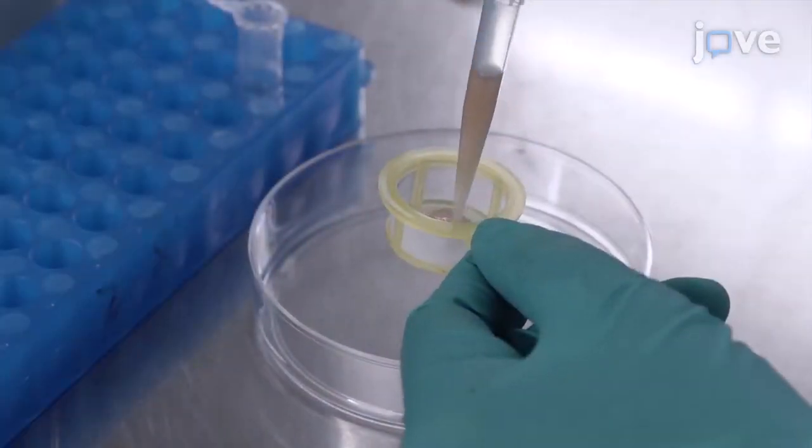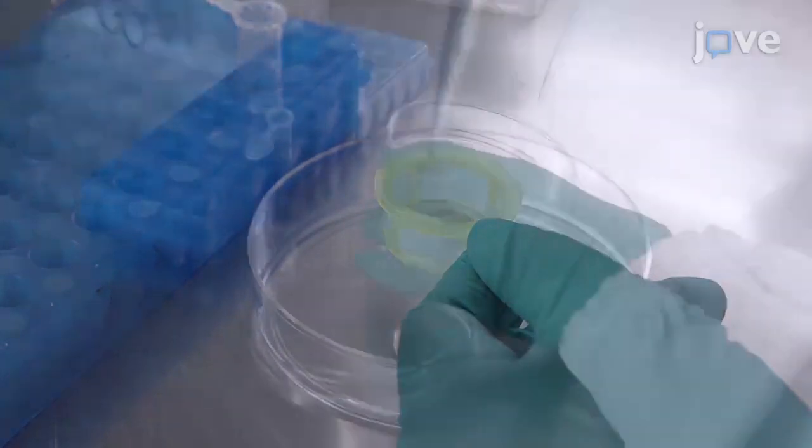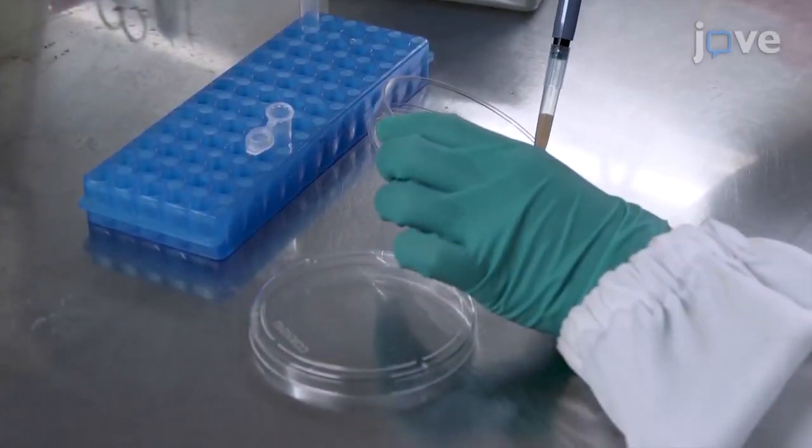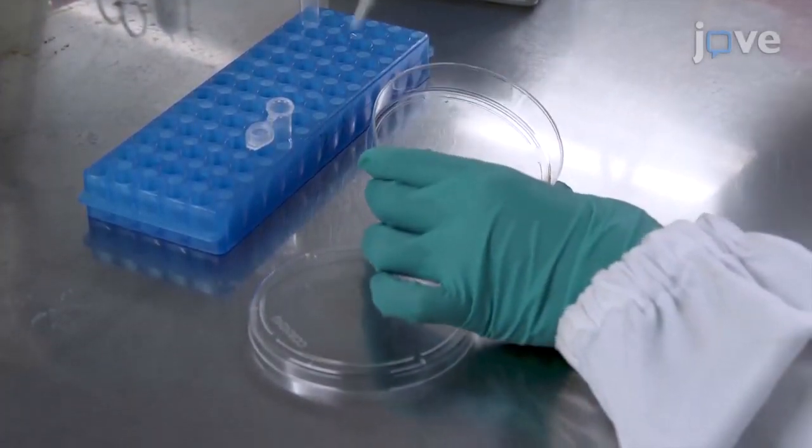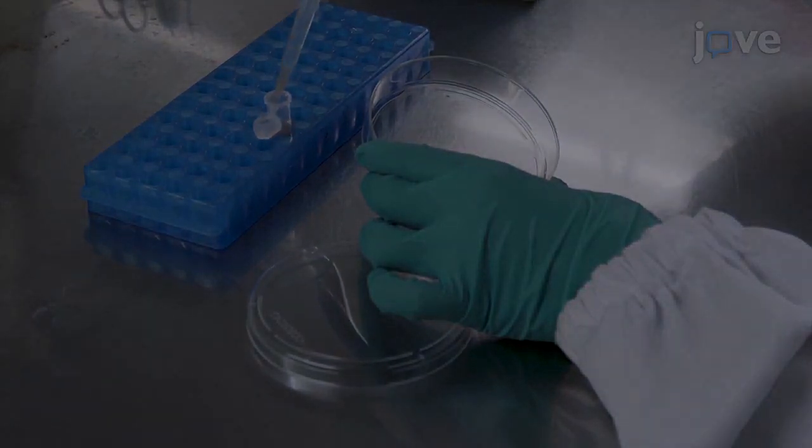Then filter the solution using a 100-micron cell strainer and collect the filtrate in a new sterile 2 ml microcentrifuge tube.